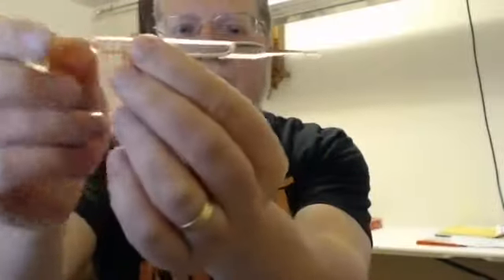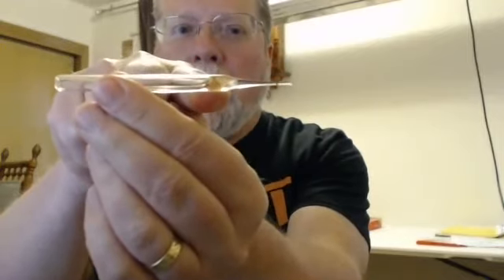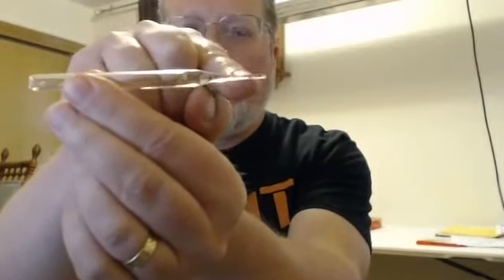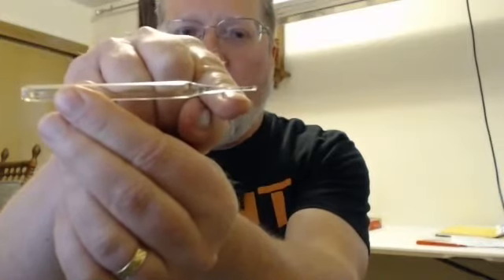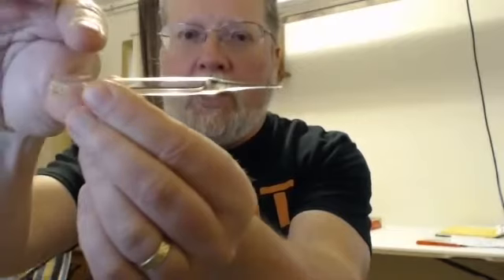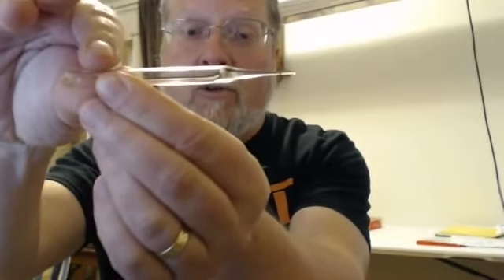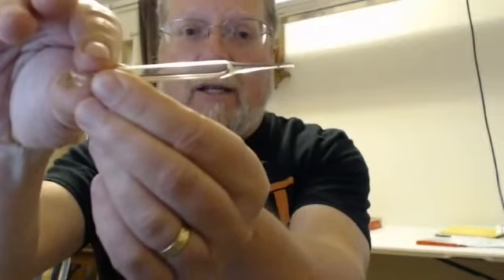These are fun. They are vacuum packed. That means there are no molecules behind the liquid. What that means, when we snap this end off below water, the pressure of the water will push the water right into this tube. It'll fill up, it'll look cool, and it does a very pretty color change.